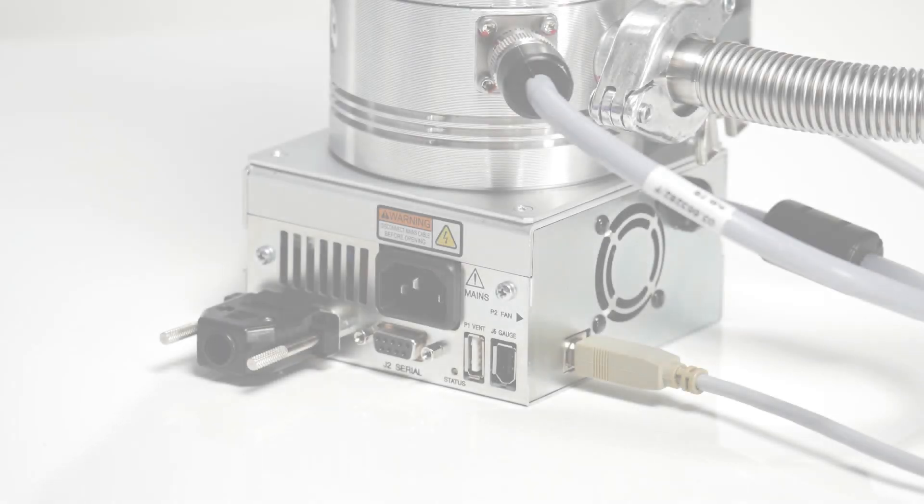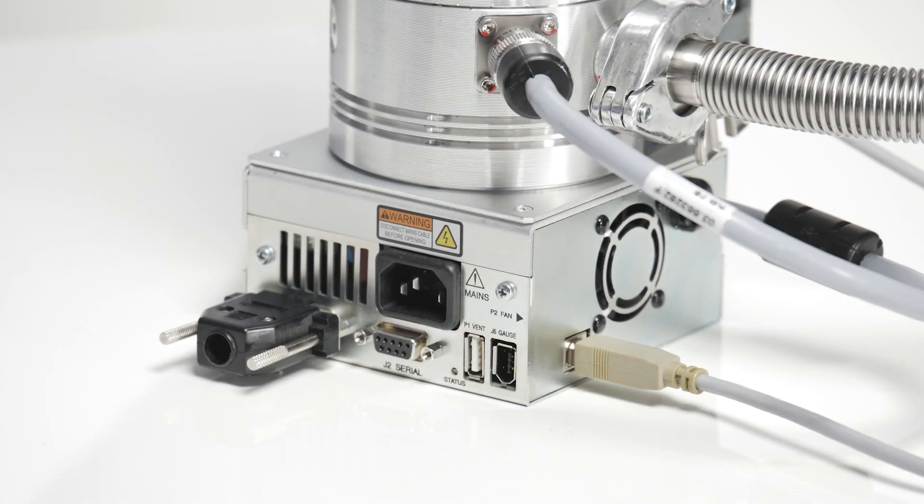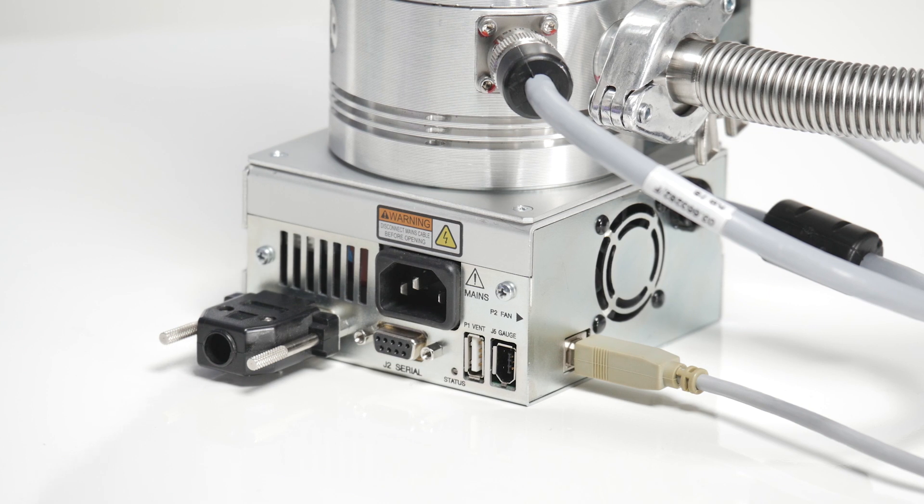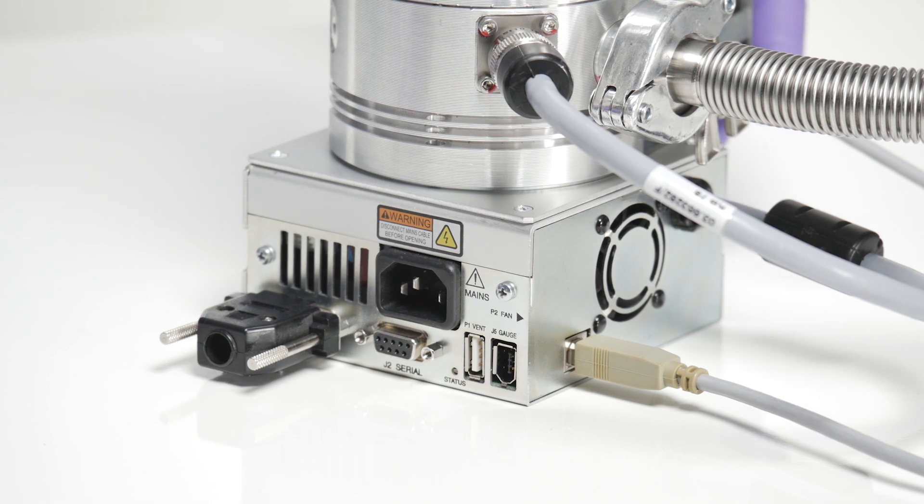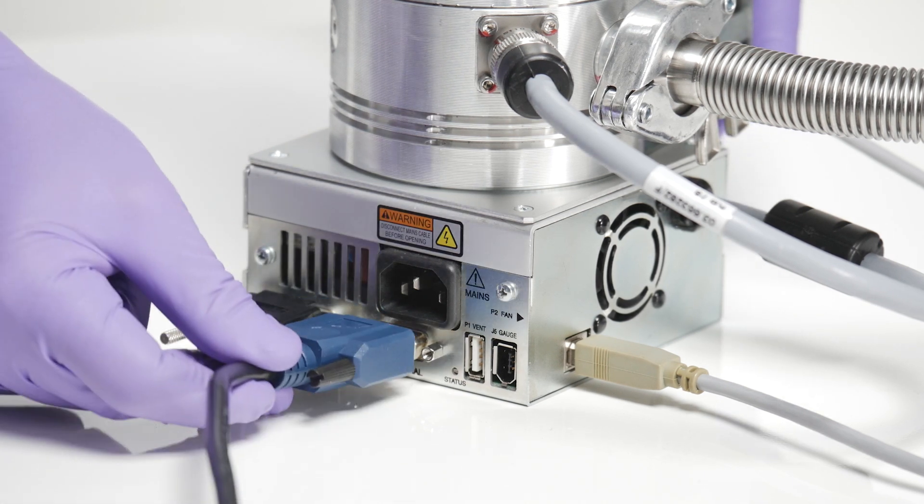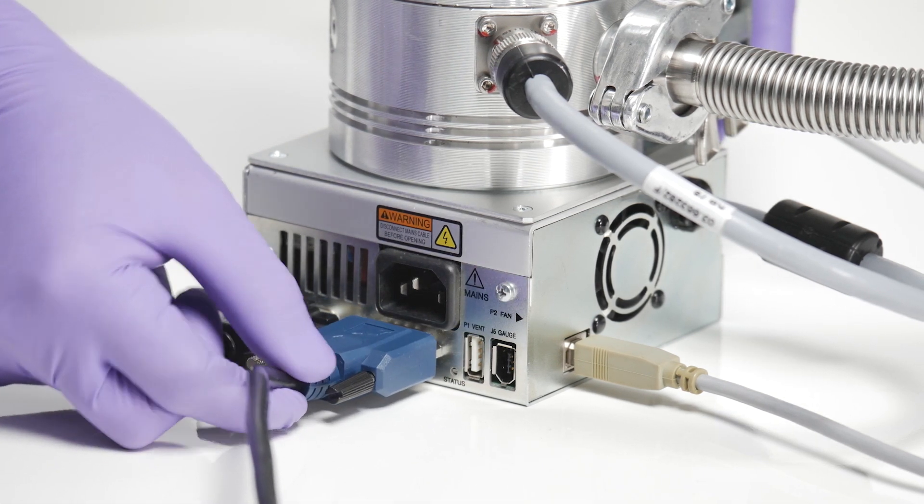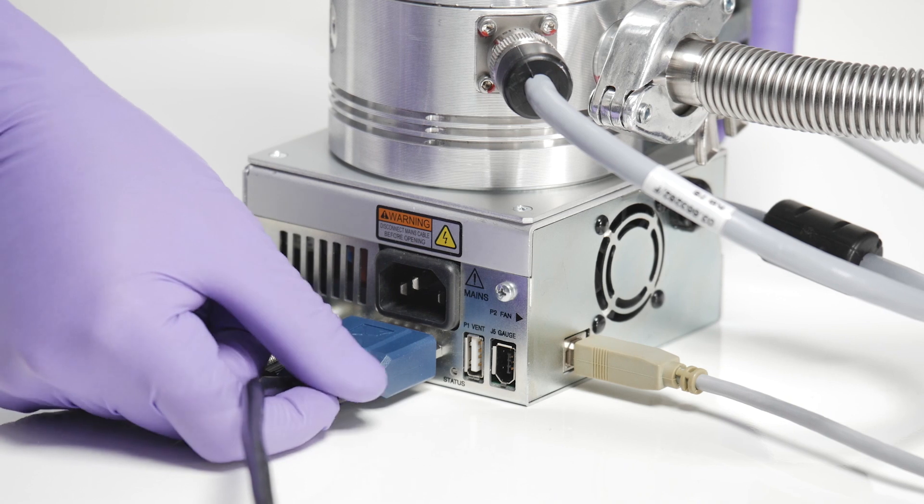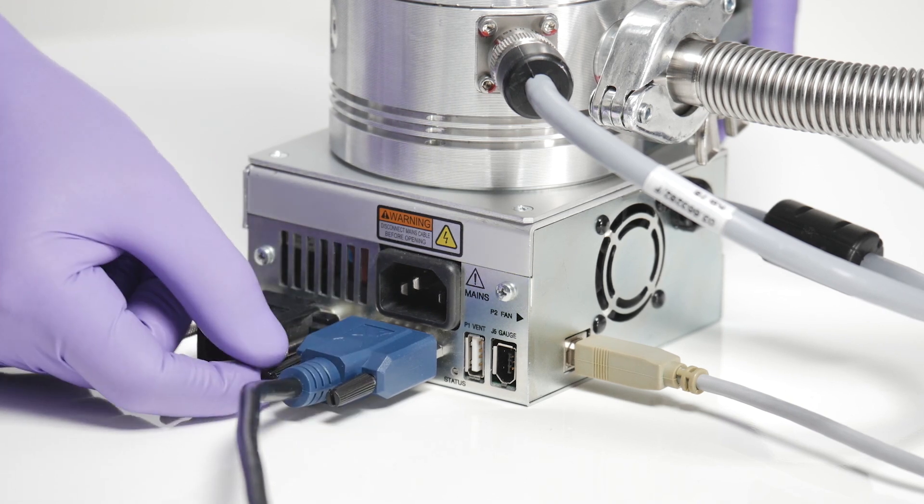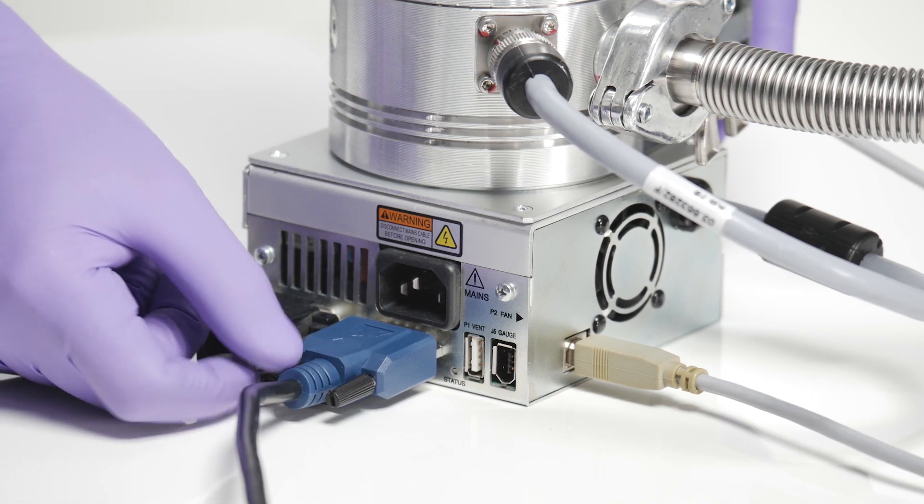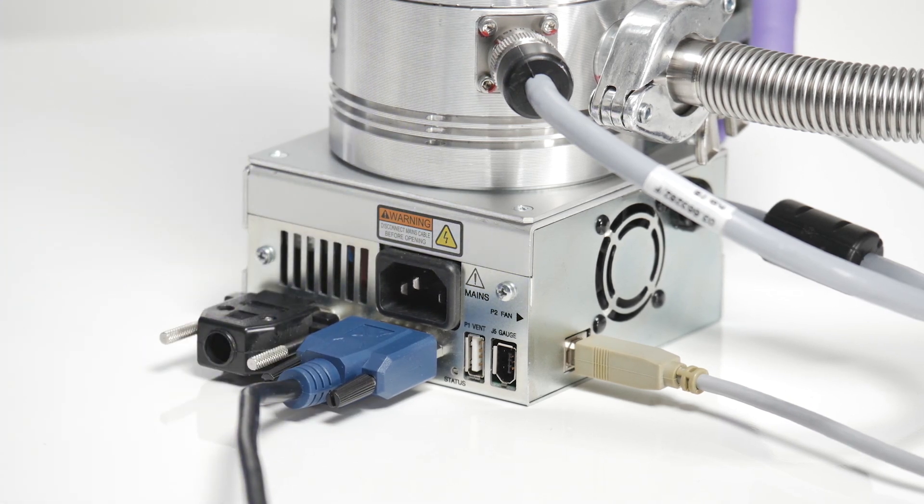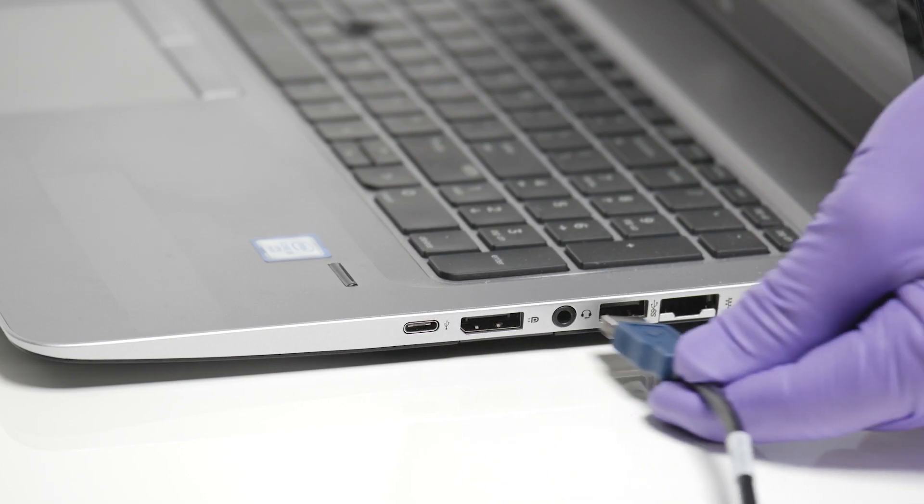Depending on your computer, an RS-232 straight cable or a USB serial converter to an RS-232 straight cable will be necessary. I've connected a USB serial converter cable to the back of the controller and plugged it into my computer.